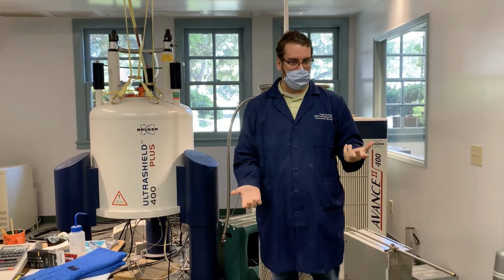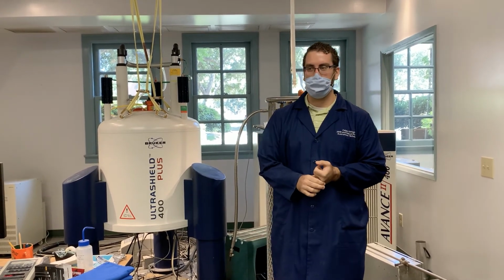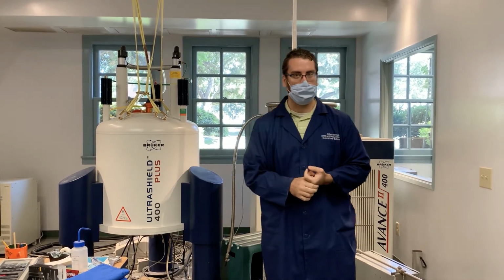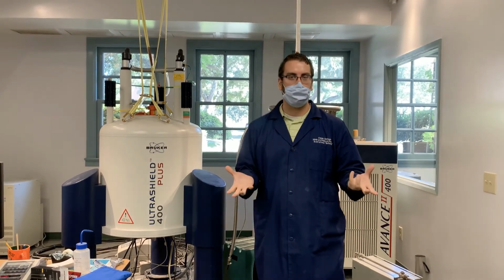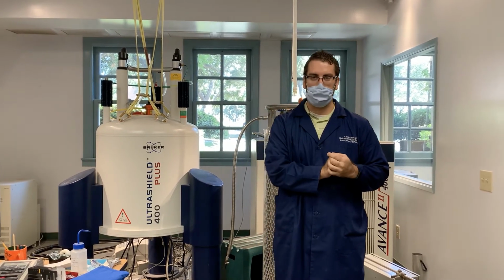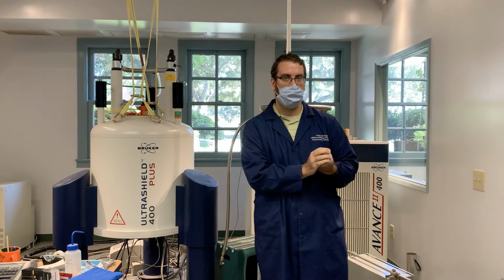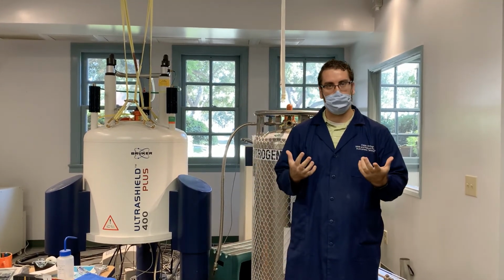Hello, I'm Caleb. I am the instrument technician here for the chemistry department at the University of La Verne. And one of the main instruments I've been working with is the NMR, which stands for Nuclear Magnetic Resonance. So what is NMR? Well, let's break down the name. In this case, nuclear doesn't mean bombs and things. Instead, it means the nucleus. We're using magnets, hence magnetic, to look at the nuclei of different molecules and detect them.